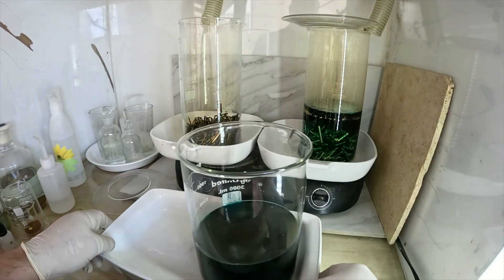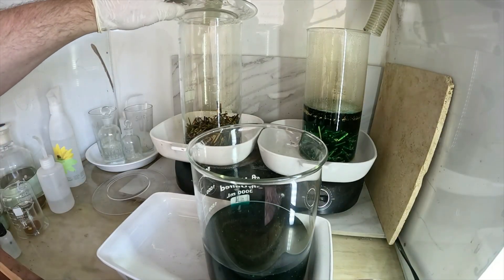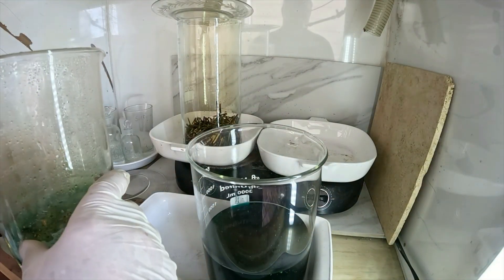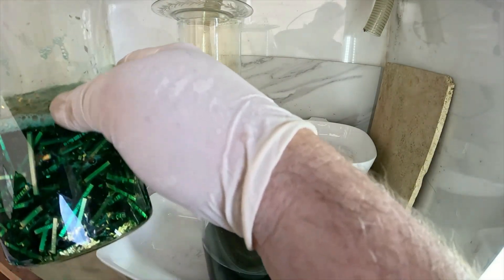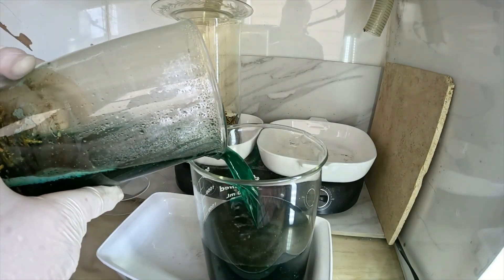That acid is exhausted. You can see the bulk of the fingers are still attached. We're going to decant these solutions, filter them to catch any of the foils that did release, and then add fresh nitric acid and heat to finish the job.